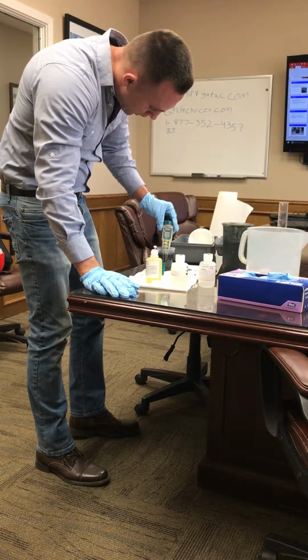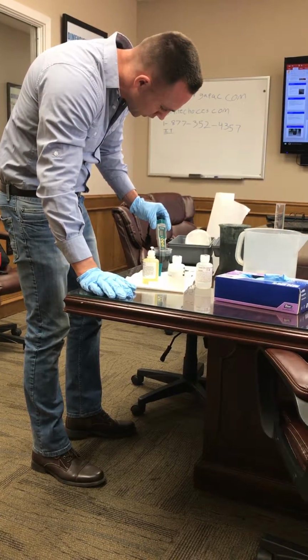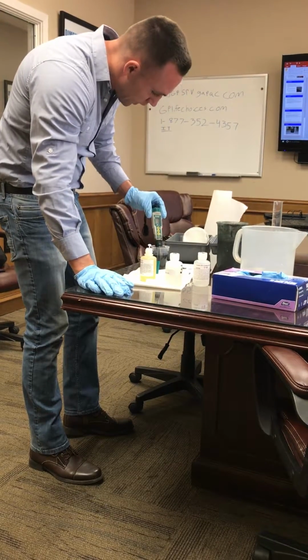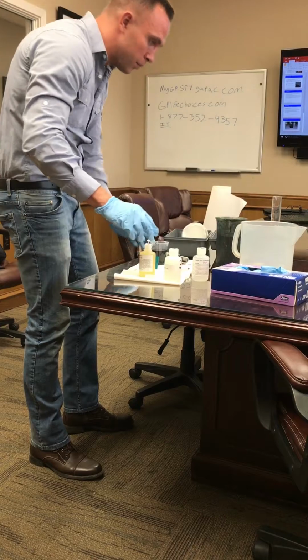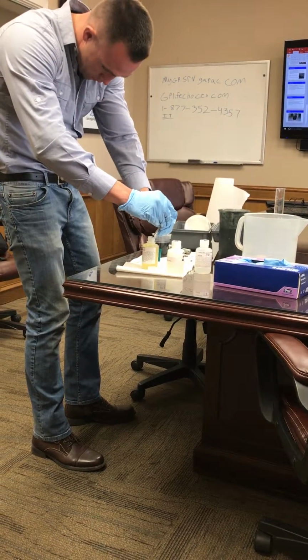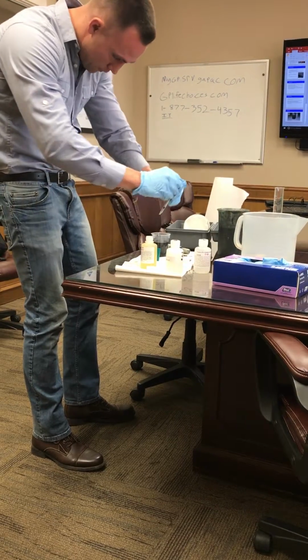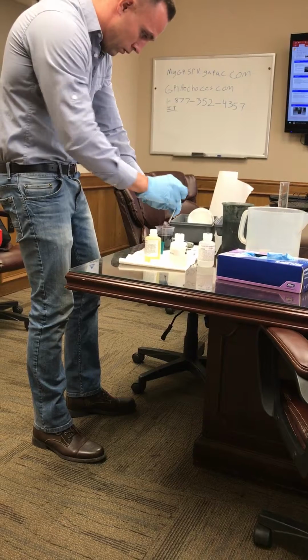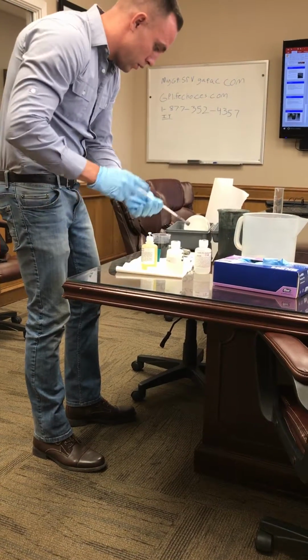It only brought it down to about a 6.5, 6.6. So I'll probably add 0.2 more, because it'll probably bring it down to that 5.7 range. Start up again.